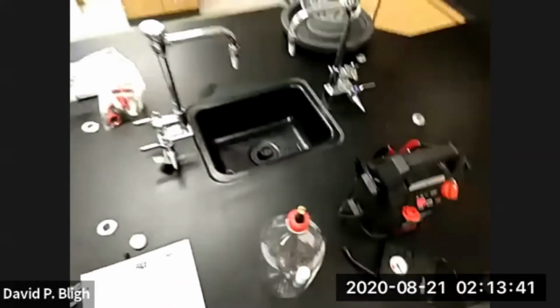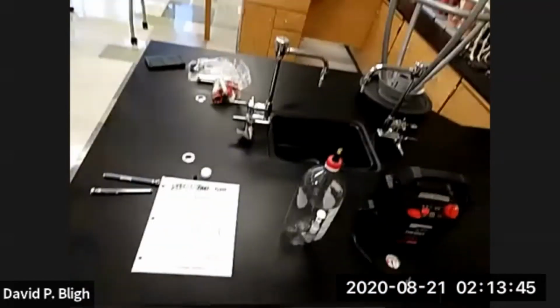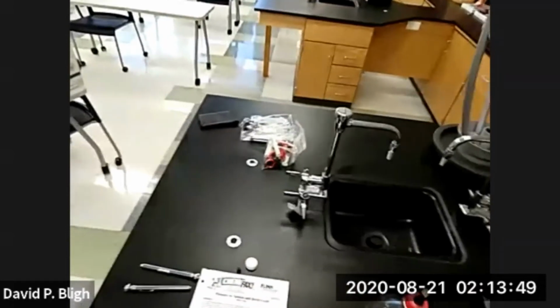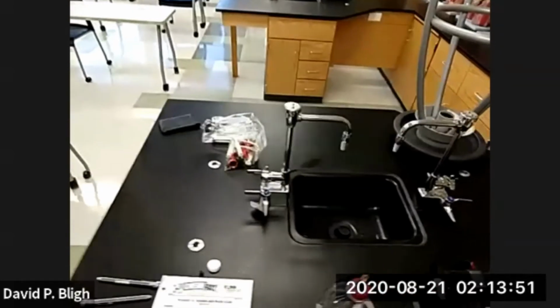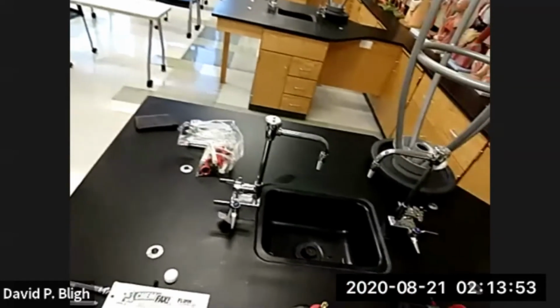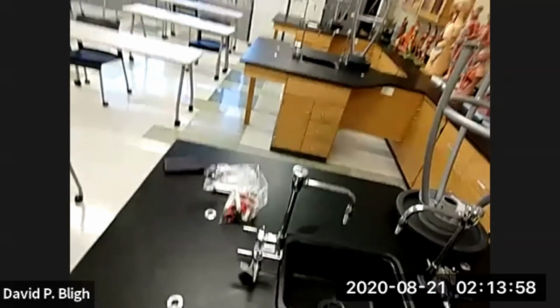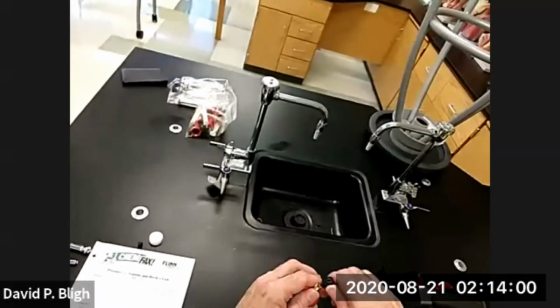All right. So for our last measurement, we need 0 gauge pressure. Just because I couldn't read it on the gauge doesn't mean it's 0. In order to be 0, we need to have the pressure so low that we can remove the cap, and now it's at atmospheric pressure.